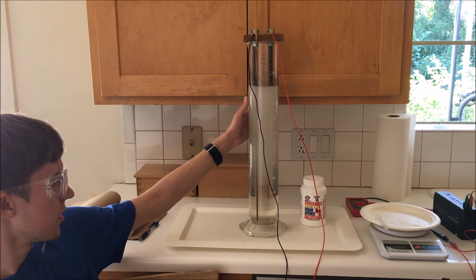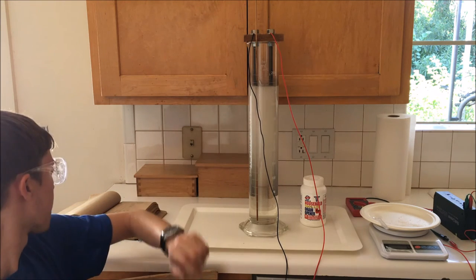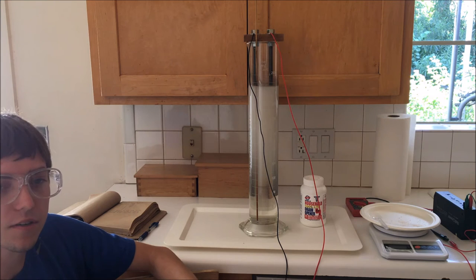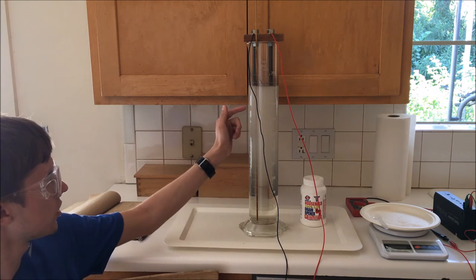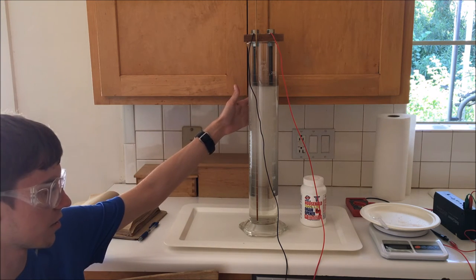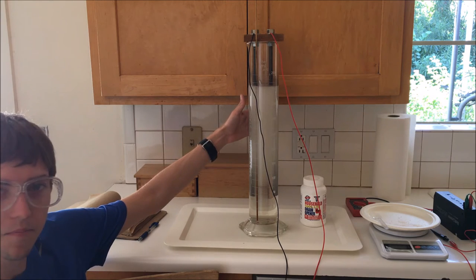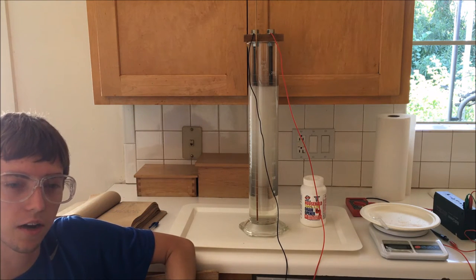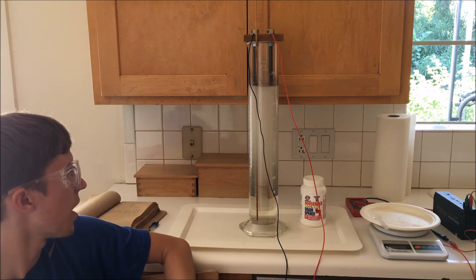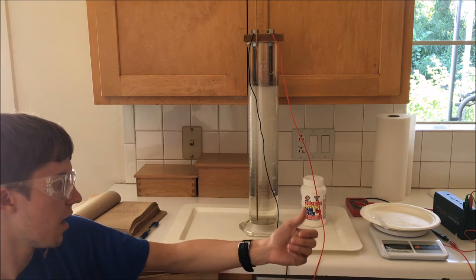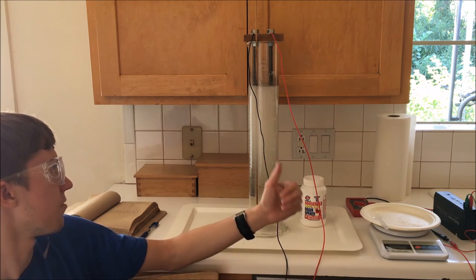This seems to be working quite nicely at 5 amps. I ended up adding approximately 15 grams of sodium hydroxide to the solution of 1800 milliliters to get this to react at this rate. So, when I set this up for long-term operation, I'm planning on applying the same amount of sodium hydroxide to the solution as I have now.